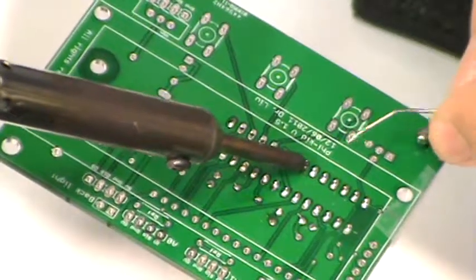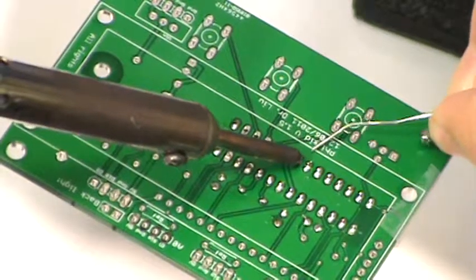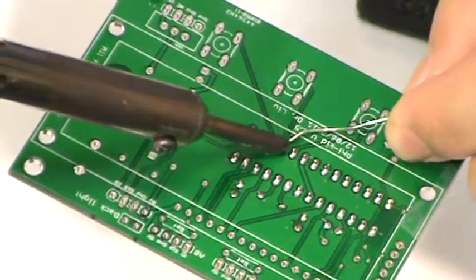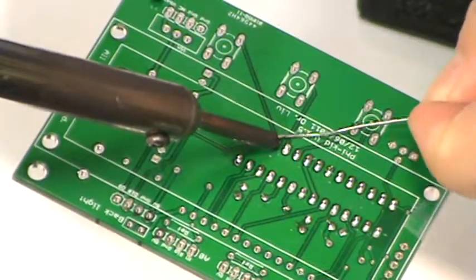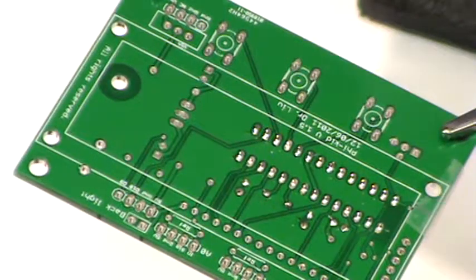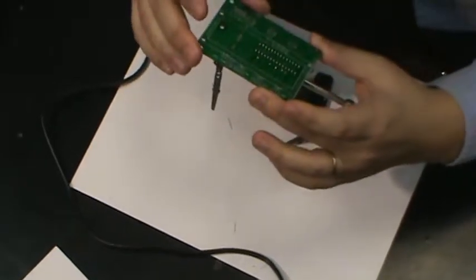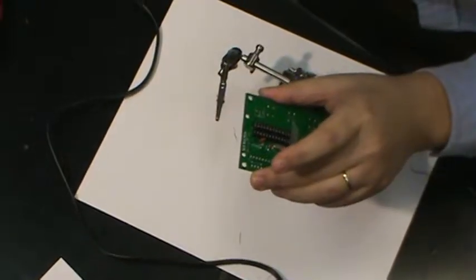This pin is probably hard to solder because it's connected to the entire copper backplane. Takes a little longer to heat up. The rest of them are pretty easy. Okay, so now we're done with these several parts, and you can look at them to make sure that you didn't miss any of the connections, and just save the tape for the next part.